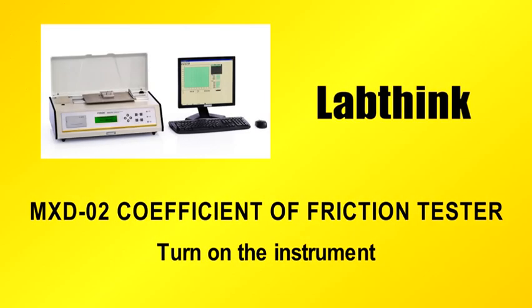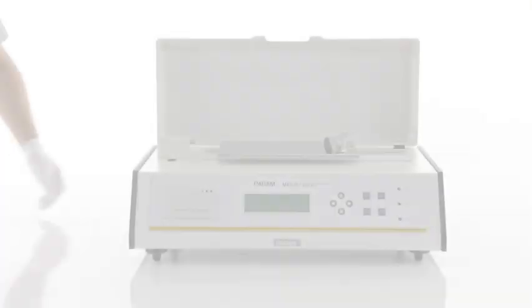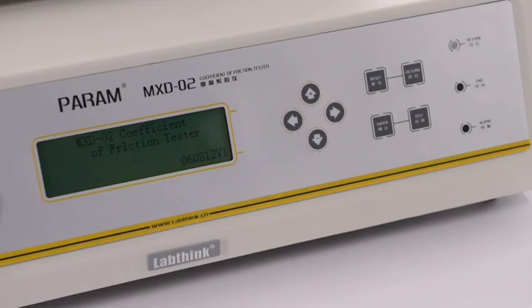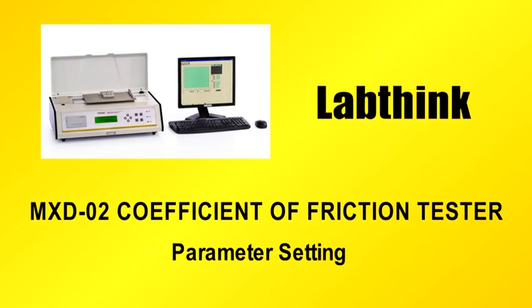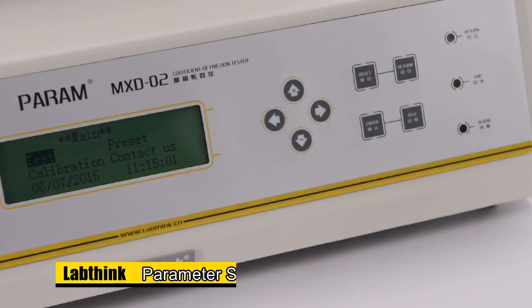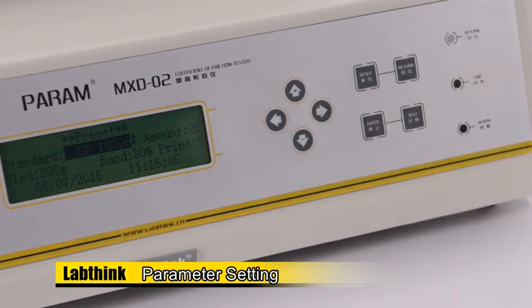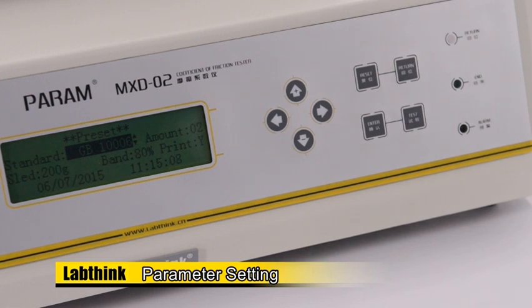Turn on the instrument. Switch on the instrument and the welcome screen displays. Press any key to enter the main interface. Parameter setting. Move the cursor to preset by pressing the left and right arrow keys. Press Enter to enter the preset interface.